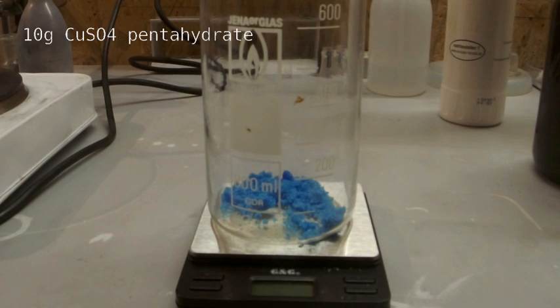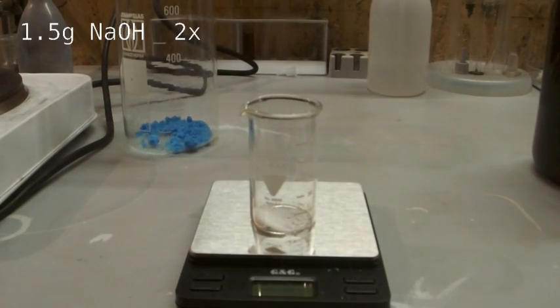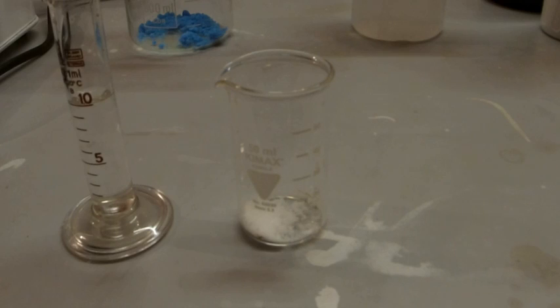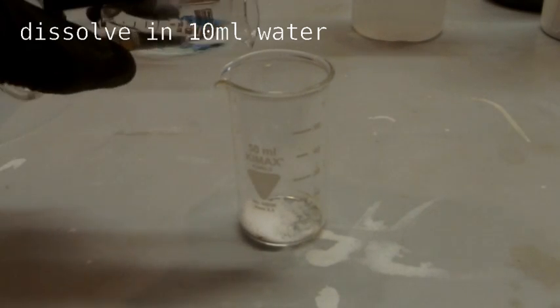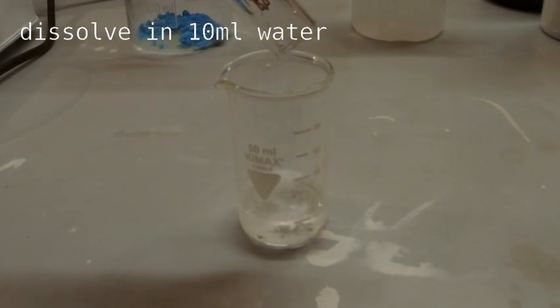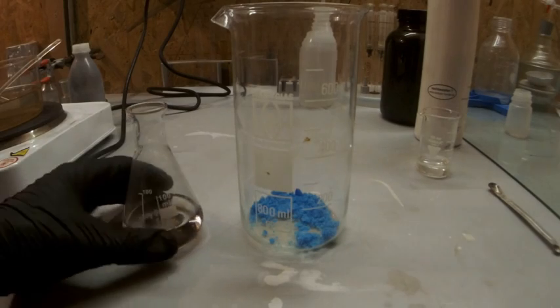Therefore I will first synthesize some copper hydroxide by simply mixing copper sulfate and sodium hydroxide in solution. In my case I used 10 grams of copper sulfate pentahydrate and 3 grams sodium hydroxide.